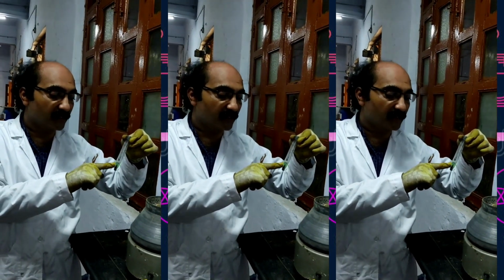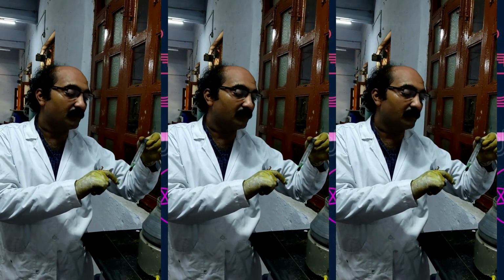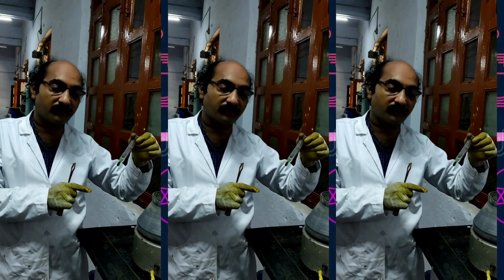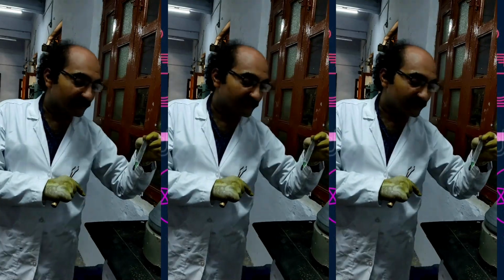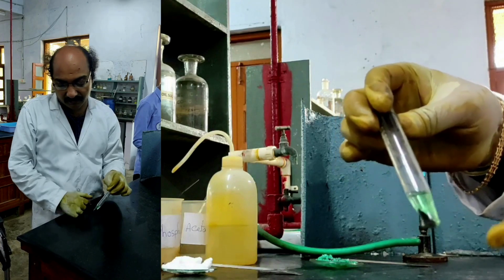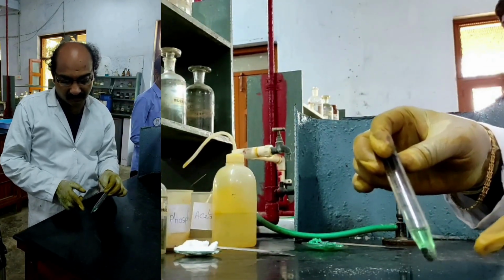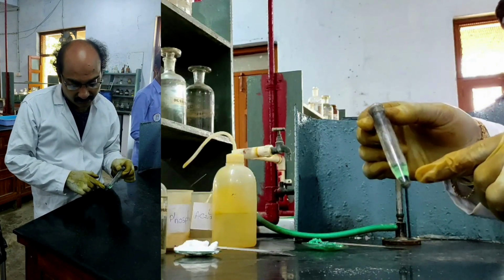And the centrifugate may contain other cations like manganese or zinc. But mind you, already we have got ammonium ion in our mixture, therefore most probably we have only nickel 2+ in this particular group. Let us examine further. This is the residue I got after centrifugation. Now the residue indicates the presence of either cobalt or nickel, but cobalt salts are generally pink in color, but the salt mixture taken by us is green in color.